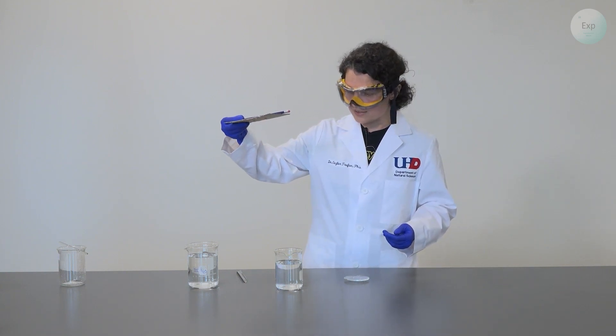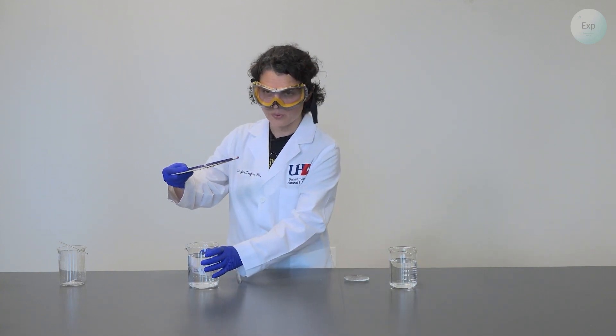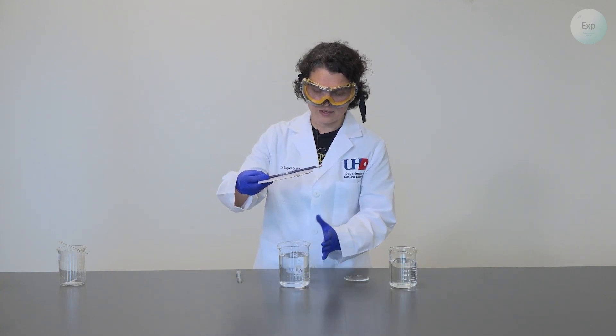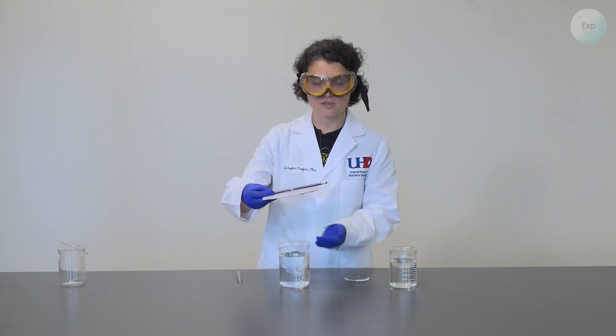I will first submerge it inside some deionized water. It doesn't matter how much water you're using or what kind of beaker you're containing it in. The important thing is that you need to have enough water so when you dunk your crystals in it, they are fully submerged.